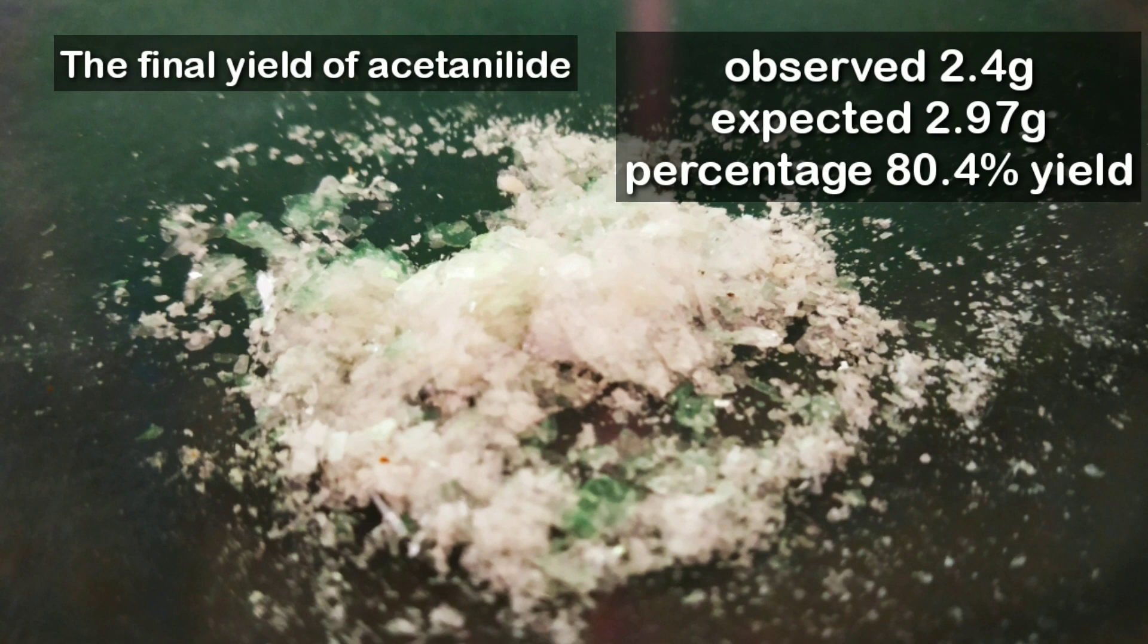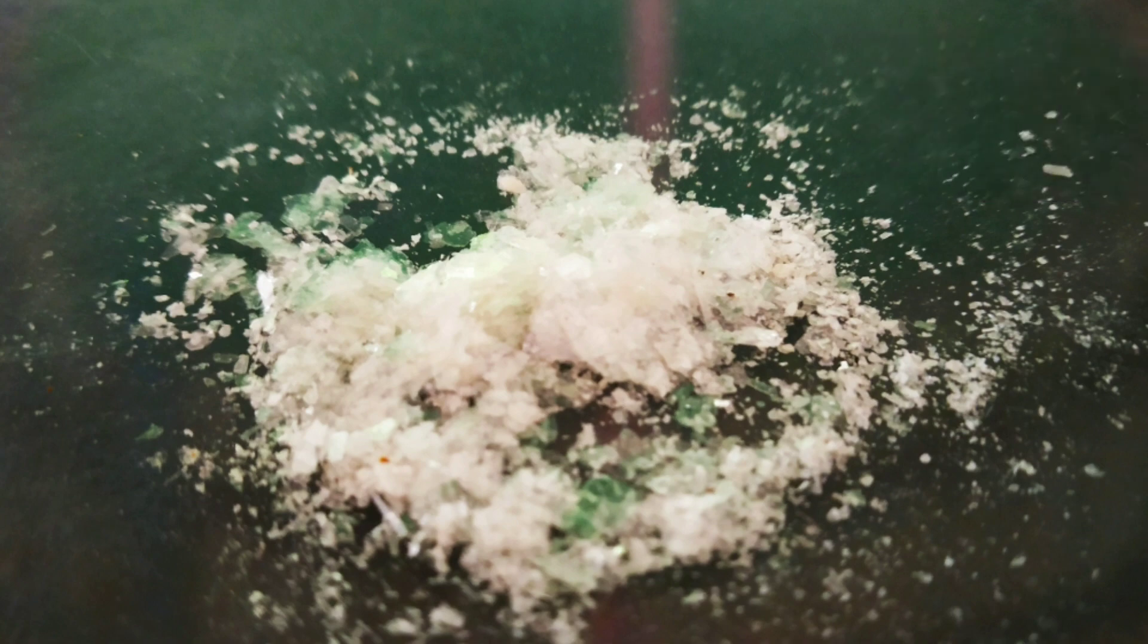Okay, now for the final yield, I got about 2.4 grams of acetanilide which is about 80.4% yield.